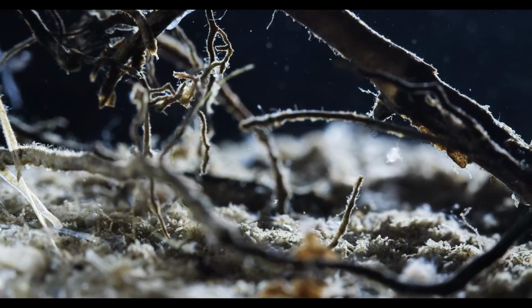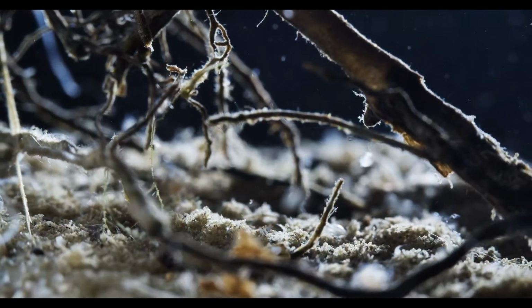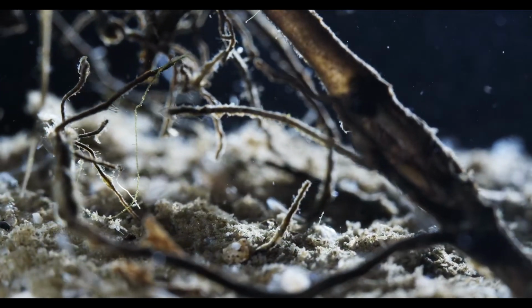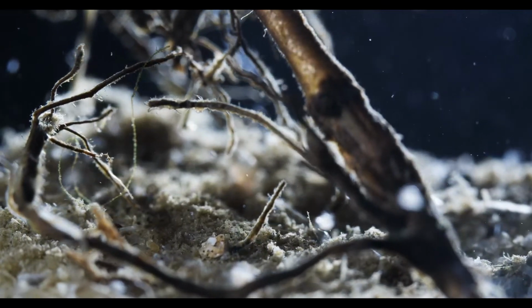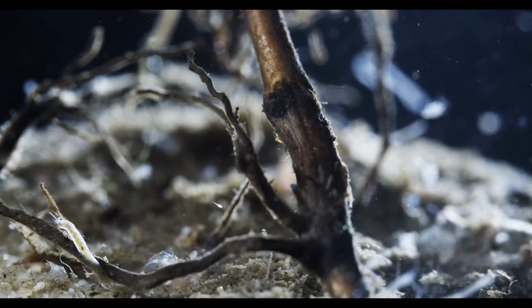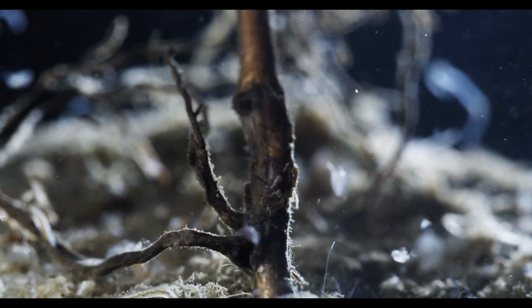There were these round algae structures in this sample when I prepared it, but it has been going for almost two weeks, I think. And the worms have since consumed all that green stuff.